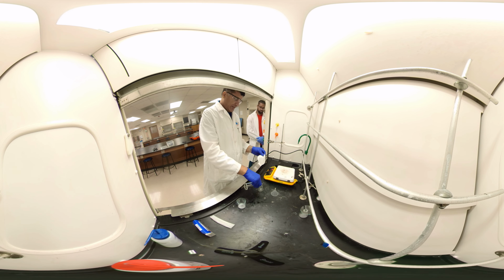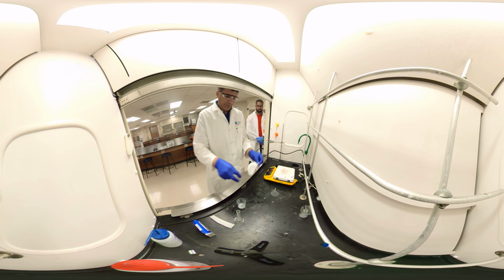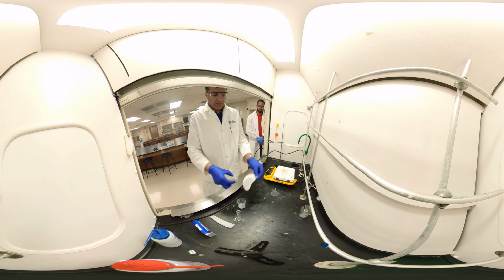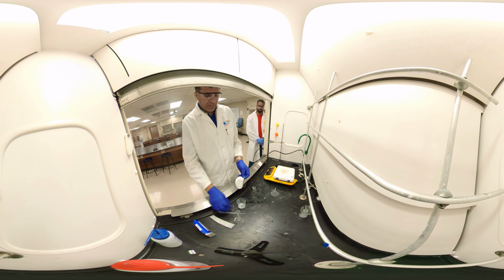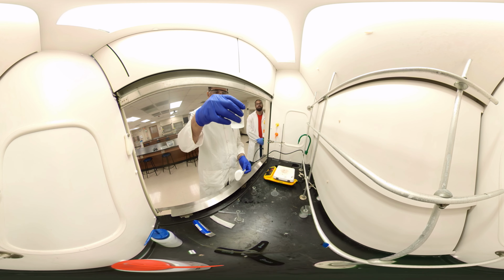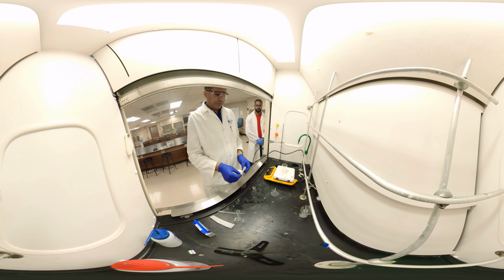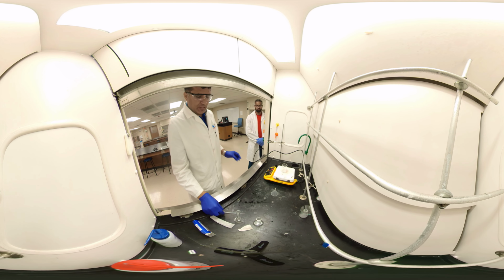And if there is something left in the very first beaker, I can swirl that one with ethanol, because it's slower. So I transfer everything, or try to transfer everything. You might see something stick there or on the side, or a little bit absorbed. That's part of the error of the experiment. We can reduce this, but we cannot completely eliminate it. So we warm up again on the hot plate. That's ethanol, with binder and acetaminophen. Put it on the side.